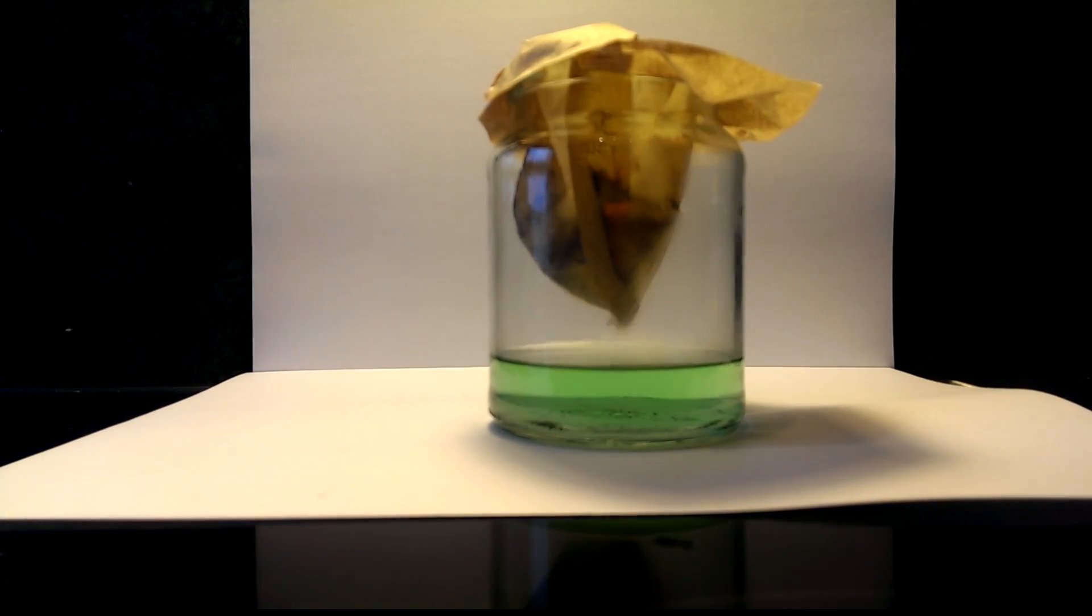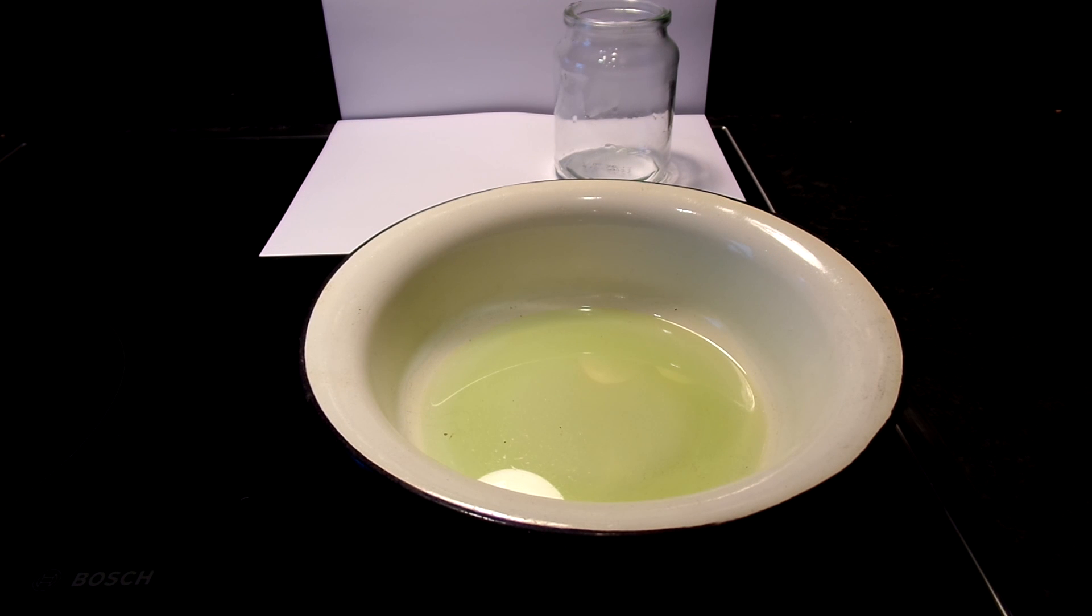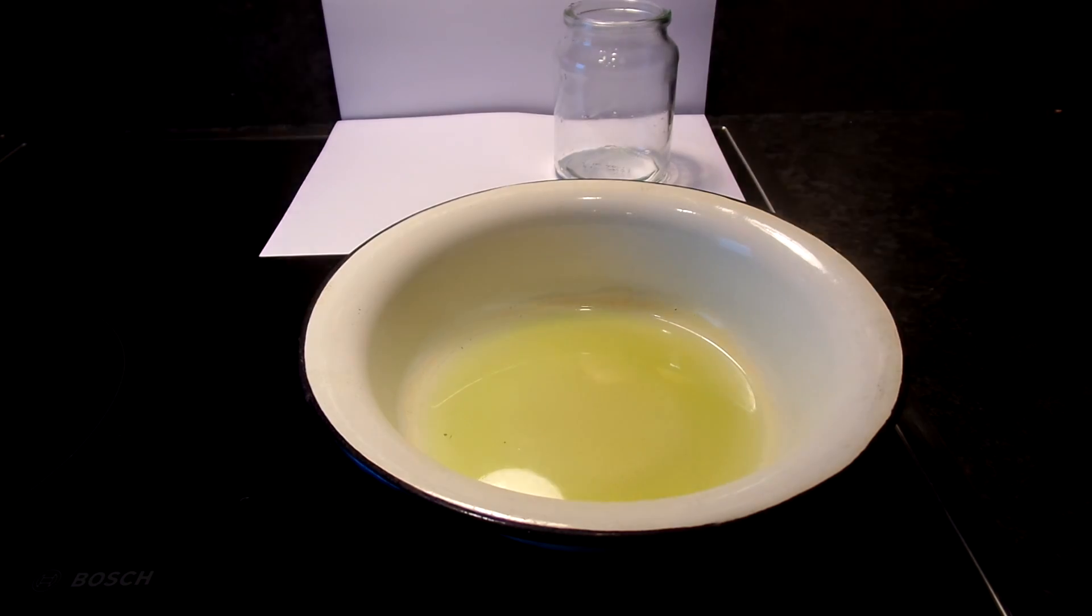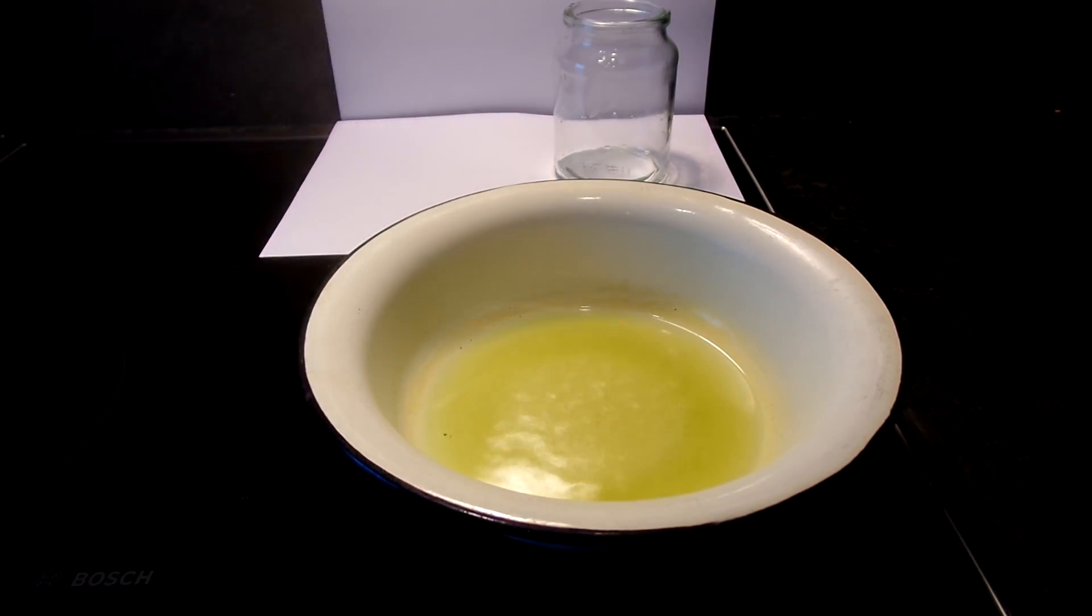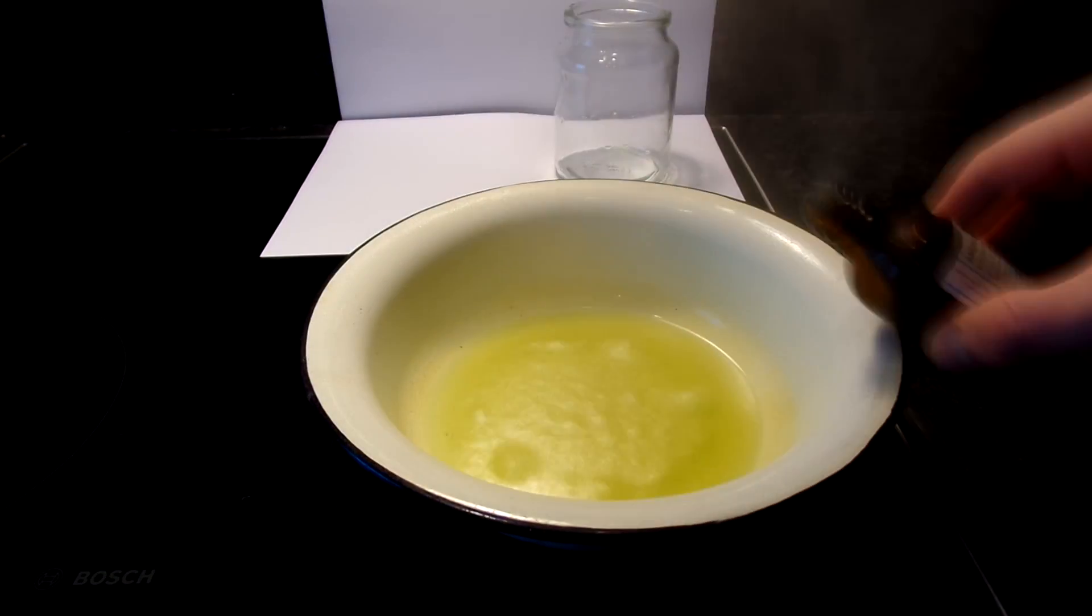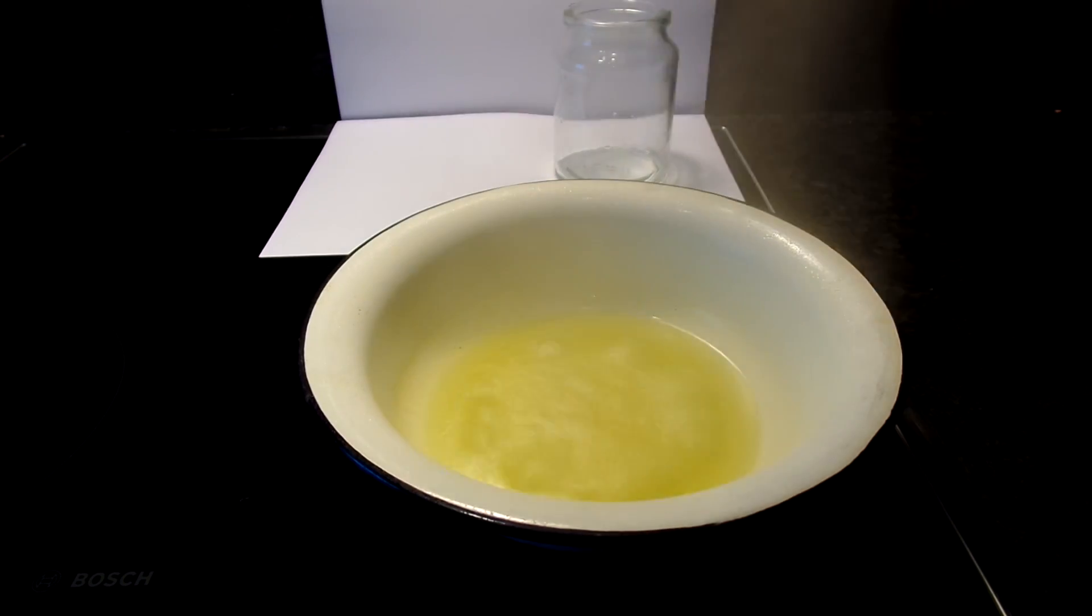The solution is filtered off. Due to the pretty high solubility, I boiled off some of the water to get the iron chloride to crystallize out.